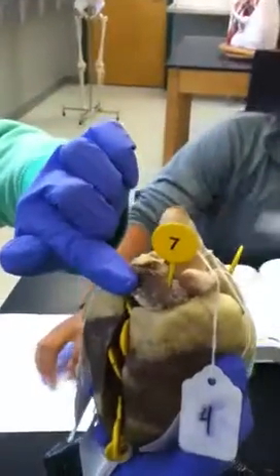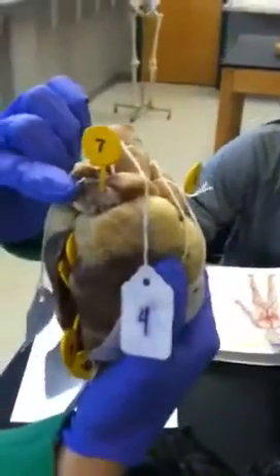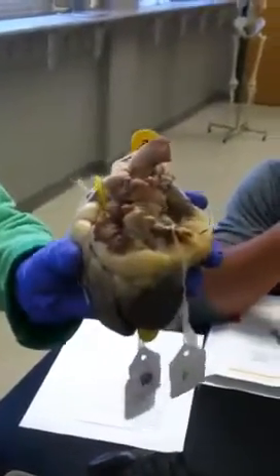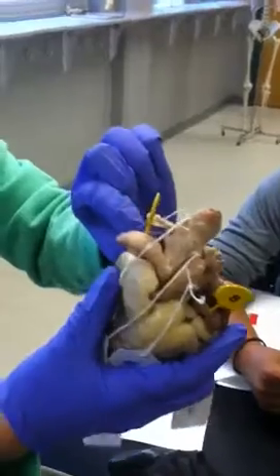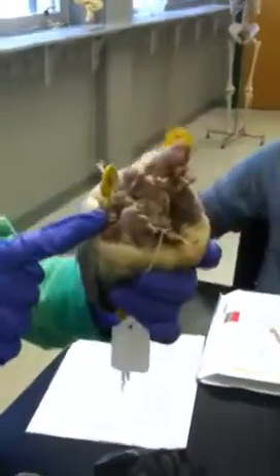All right. Number 7 is the right auricle, and number 8 is the left auricle. These are the ones that are on top of the atrium, which expand and increase atrial volume. It allows for more blood flow. What's the difference between the two? Number 7 is the right, and the other is the left, because this is the right heart, and this is the left. One's right, one's left.